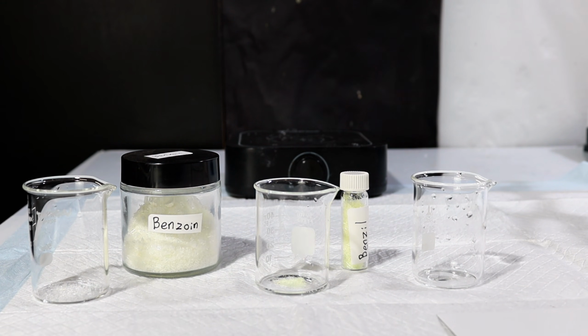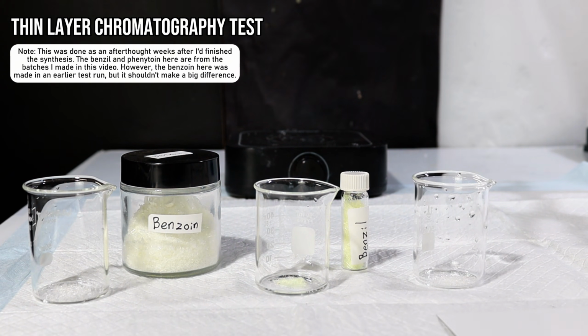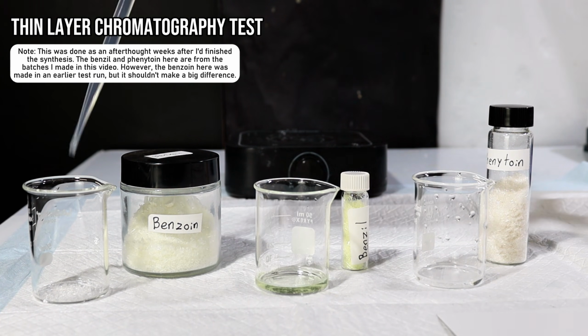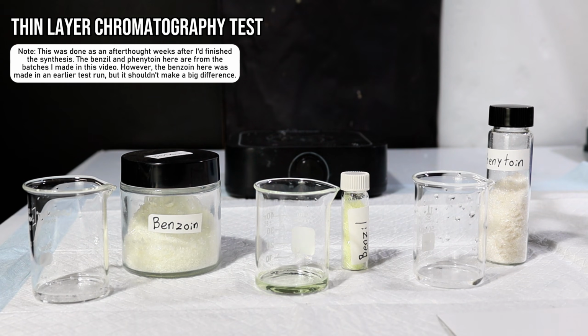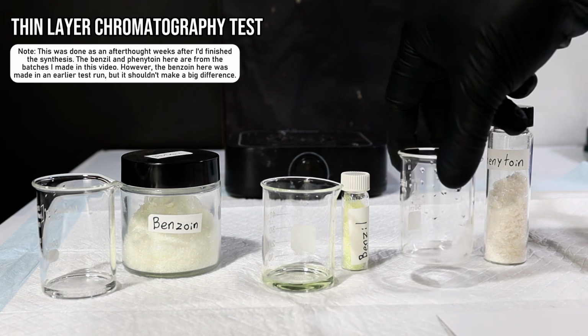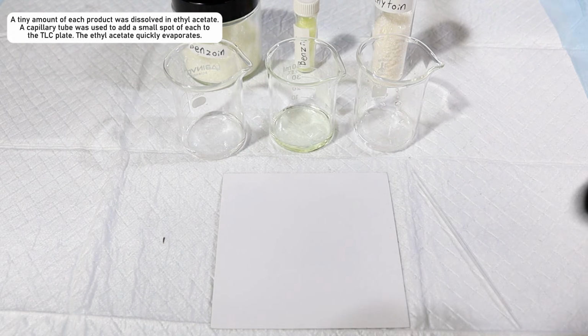I then decided to run a quick TLC, which I briefly showed earlier in the video. To do this, I first dissolved a tiny amount of my 3 products, benzoin, benzil, and phenytoin, into a few milliliters of ethyl acetate. If you're curious why there's so much benzoin here despite seeing me use most of it earlier, it's because this is the benzoin from my first trial run, and at this point I hadn't really decided what to do with it yet.